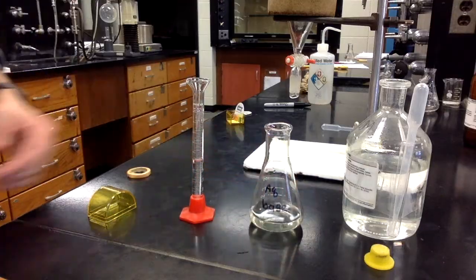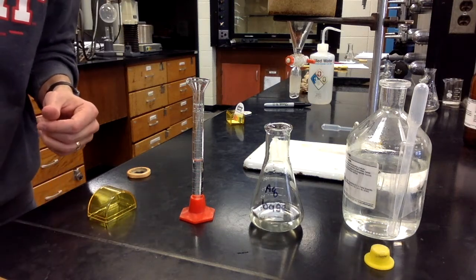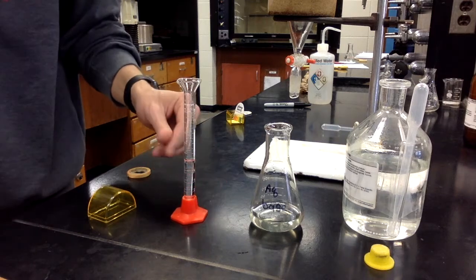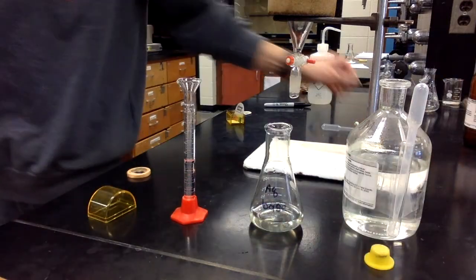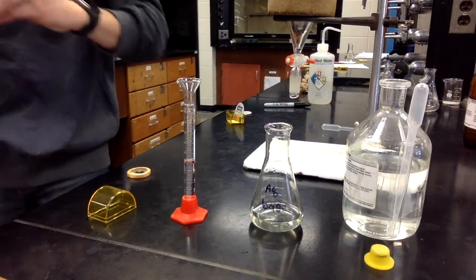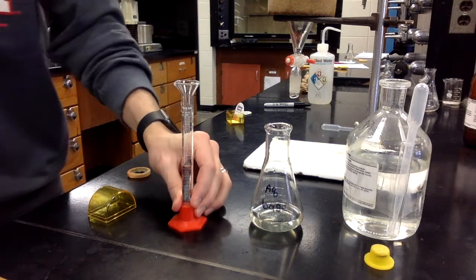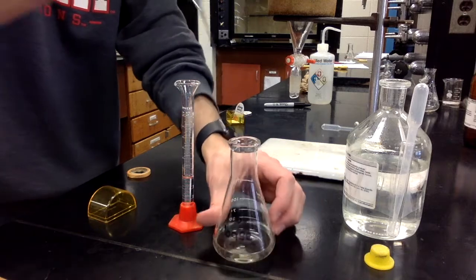There it is. It's about 1. Aqueous base flask here. It says, now take the aqueous base flask and carefully add 5 milliliters of 6 molar HCl. Do you want a pipette? Sure. I can actually just use this one. Actually, here we go. This one's good. So we have our 5 mils of the 6 molar HCl here. We're going to drip this into the aqueous base.